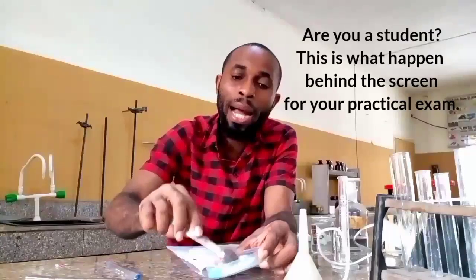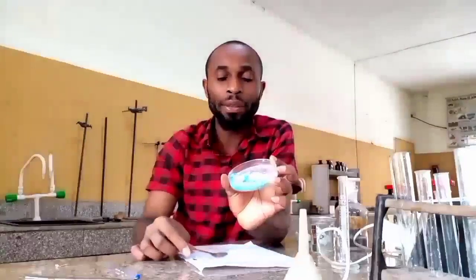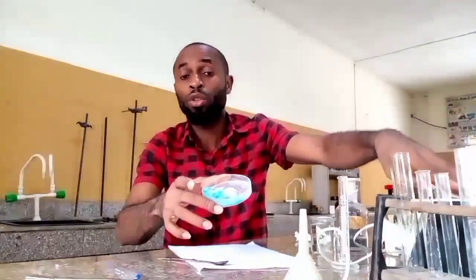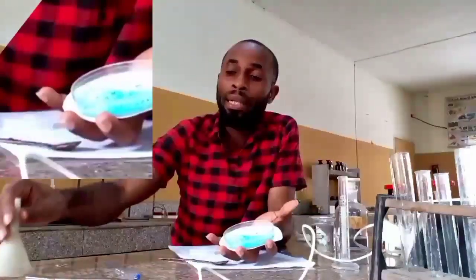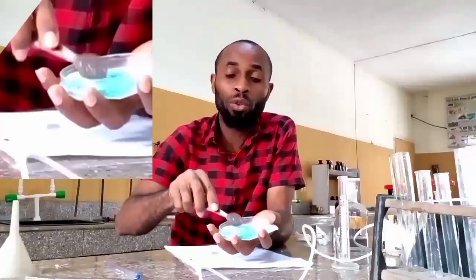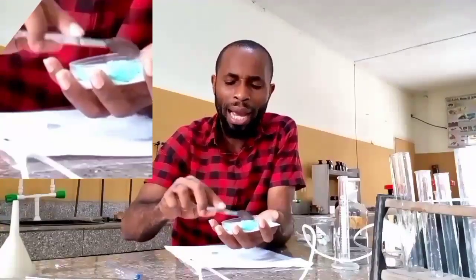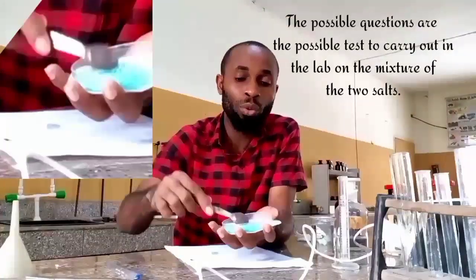And if you are a student, this is actually what you are going to be given as sample C in your practical. I believe if you follow this to the end, you will understand what you're going to do. They're going to ask you to carry out some exercises on this. I have already prepared possible questions they are going to ask you to do.